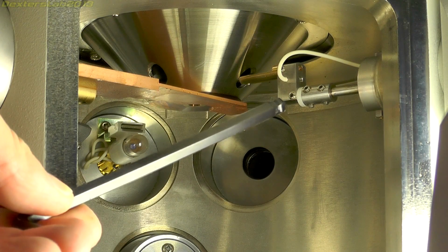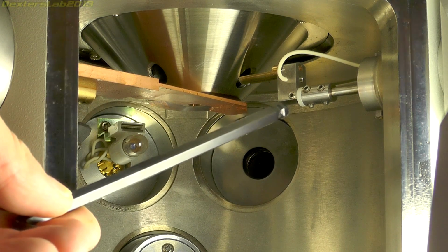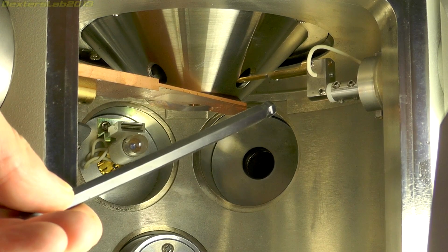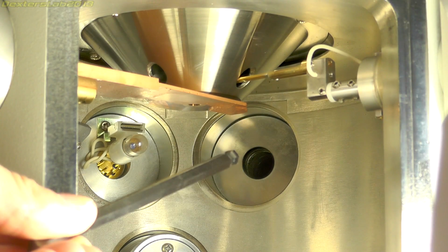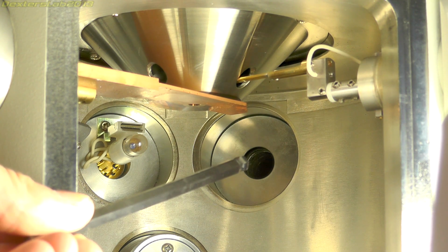We also have this control, which is for adjusting the aperture of the objective lens. This controls the overall size of the final electron beam, and it's operated by a small hand control on the outside here. Just here, we have a port on the sample chamber, which connects up to the ion pumps. Not really sure what that is there for. Hope maybe we'll get some answers when we start taking things apart a bit further.